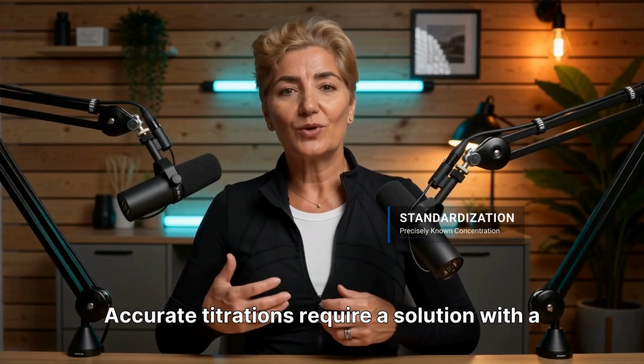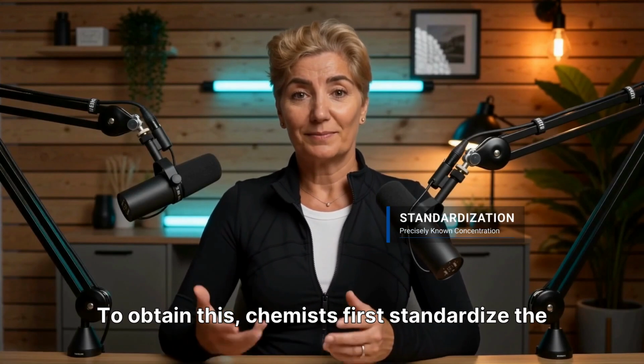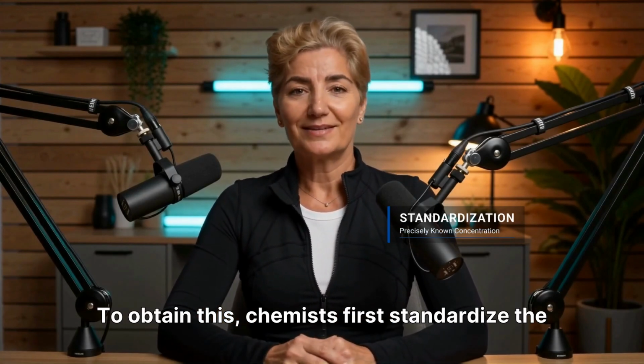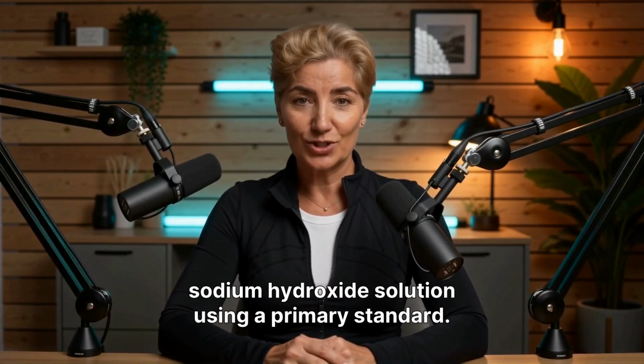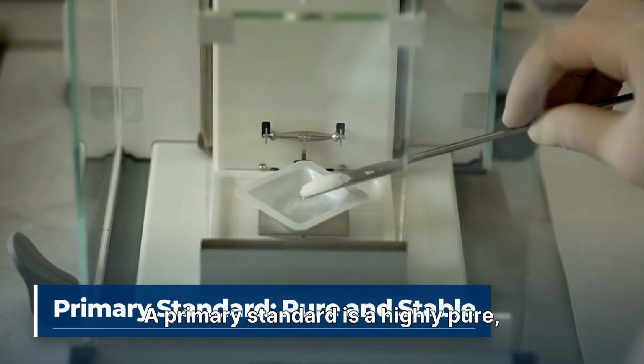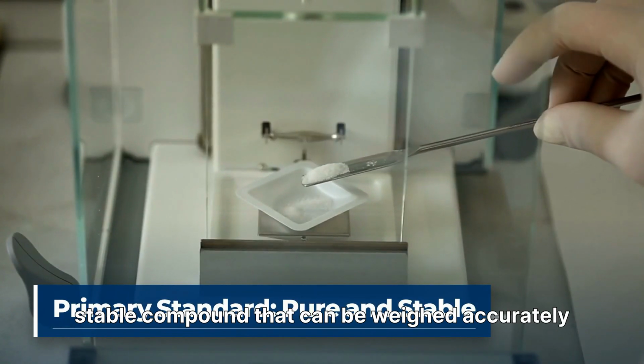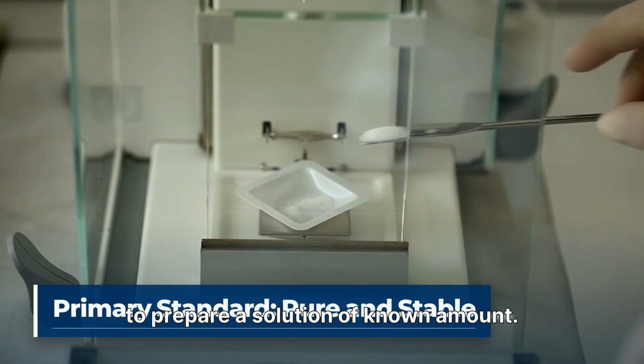Accurate titrations require a solution with a precisely known concentration. To obtain this, chemists first standardize the sodium hydroxide solution using a primary standard. A primary standard is a highly pure, stable compound that can be weighed accurately to prepare a solution of known amount.